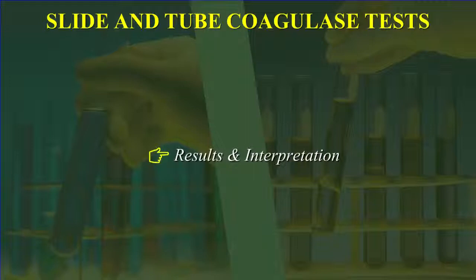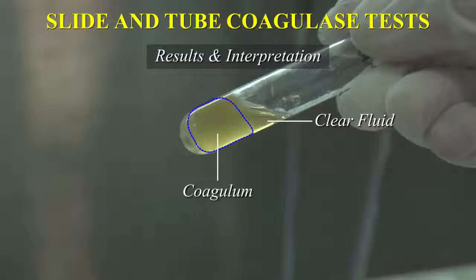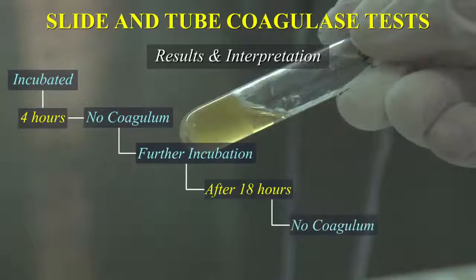Results and interpretation. A positive tube coagulase test is indicated by the formation of a stable clot or coagulum which is easily visible by slightly tilting the tube. If a test is negative after 4 hours, it should be further incubated at room temperature and observed again after 18 hours. If still the tube shows no coagulum, the test strain can be safely reported as coagulase negative.